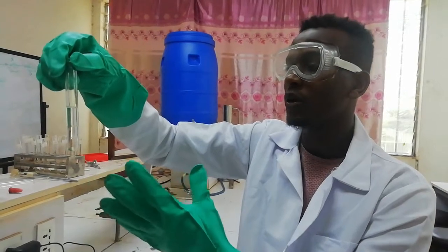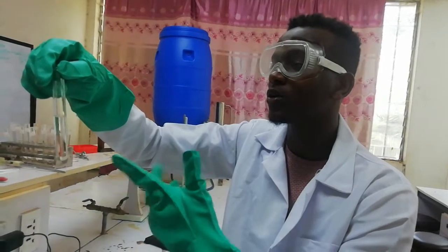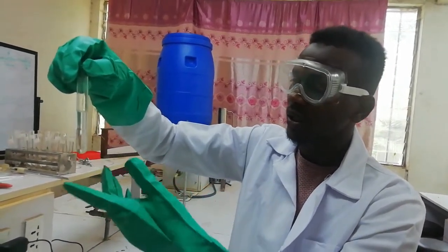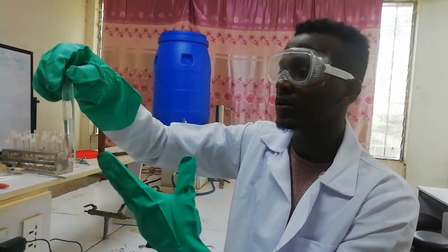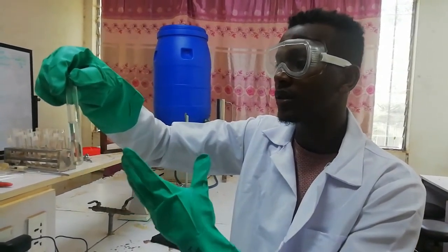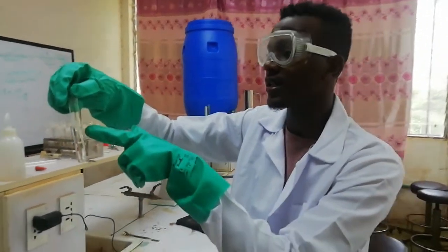So we have to do another analysis to identify what this substance is. Since your unknown substance is not miscible with water, you can calculate its density and also the boiling point. By measuring the boiling point, you can identify what this substance is.